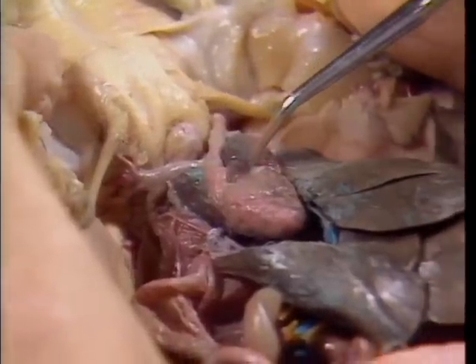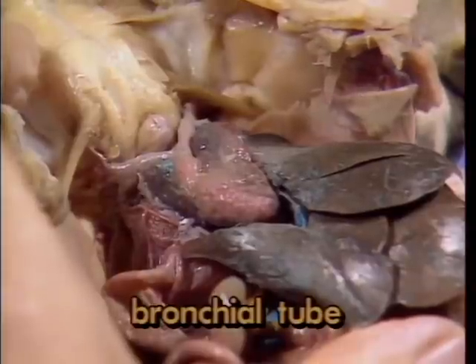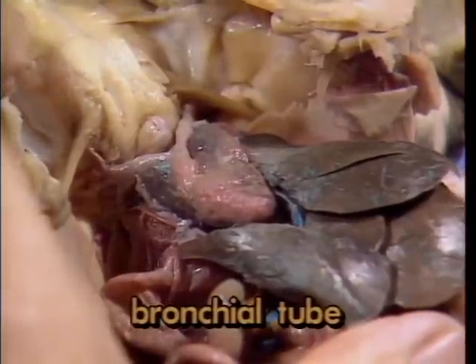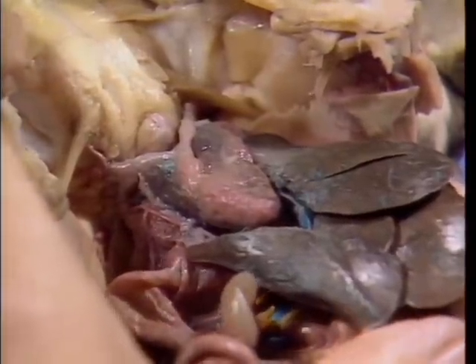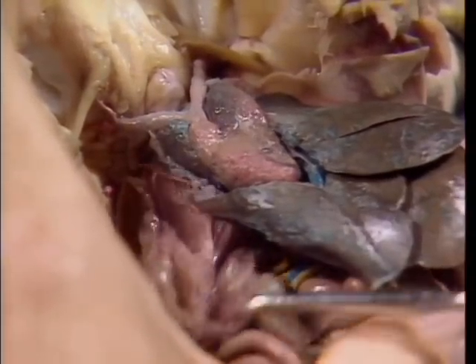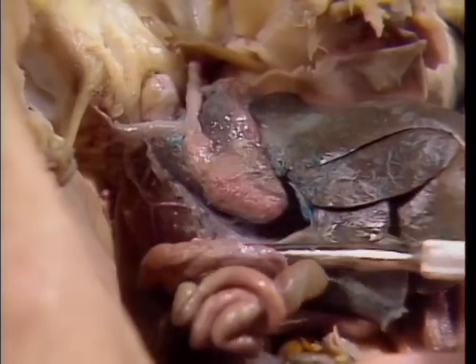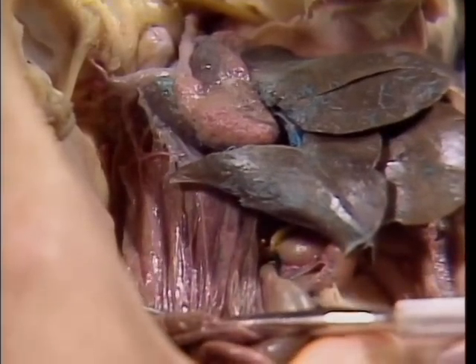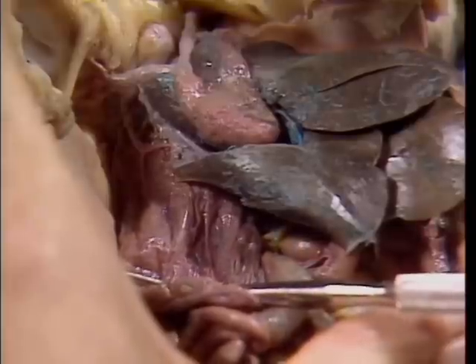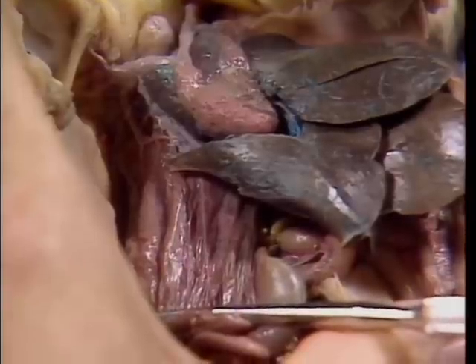From the trachea, air moves to each lung by way of a short bronchial tube. The lung is a thin vascular sac. In the microscopic capillary beds of the lungs, oxygen is taken up from the inspired air, and carbon dioxide, a byproduct from metabolic processes in the body, is released from the blood.